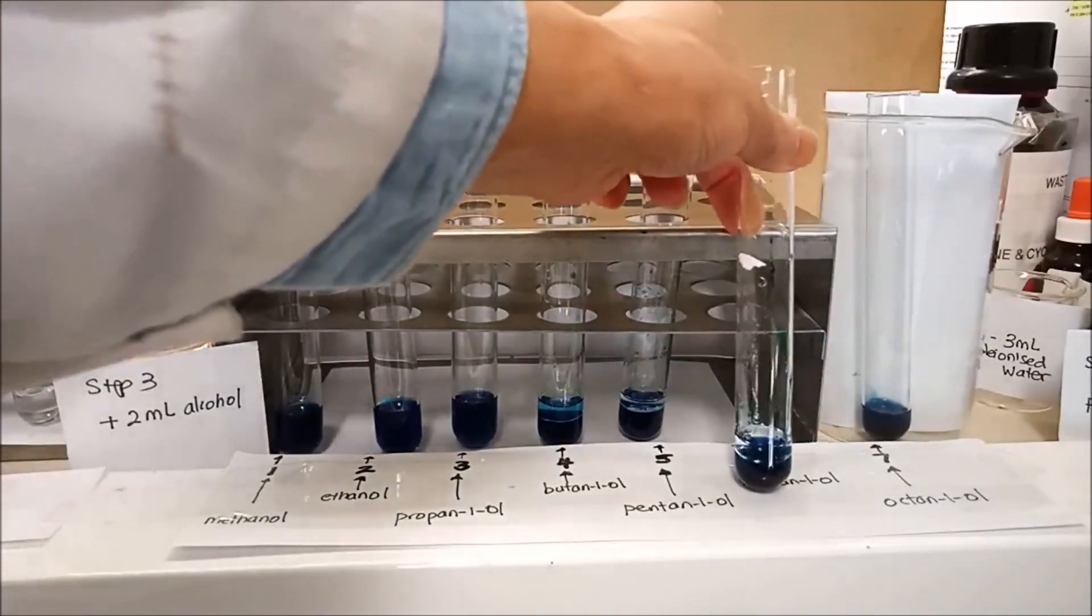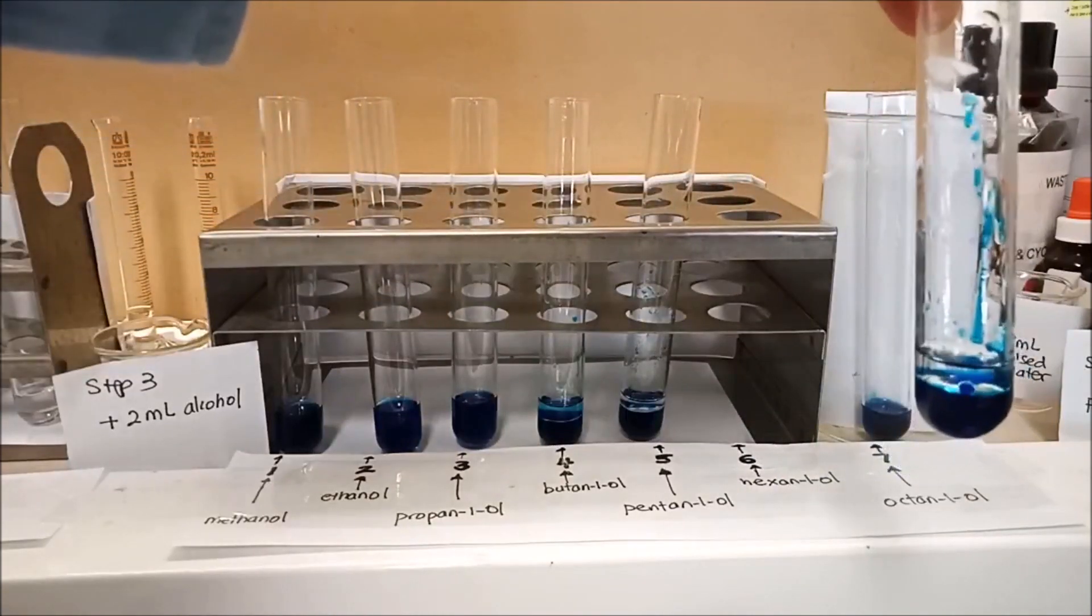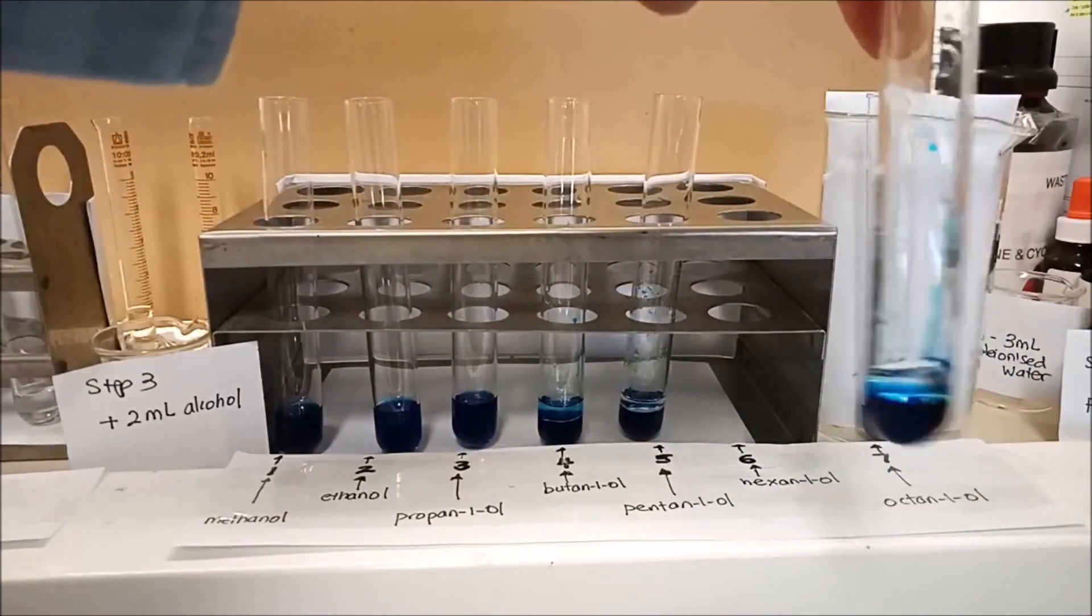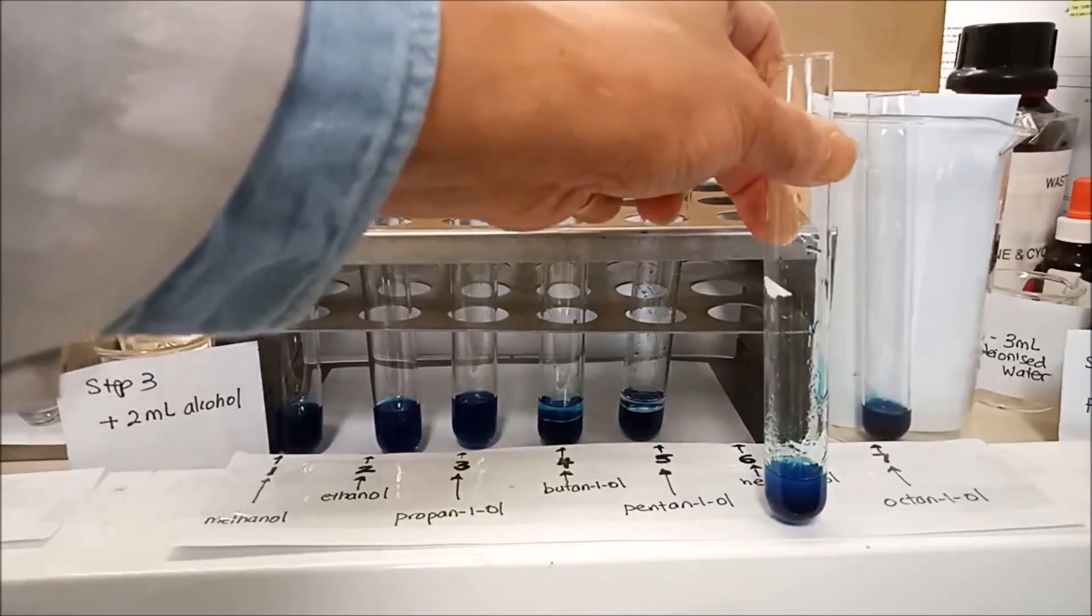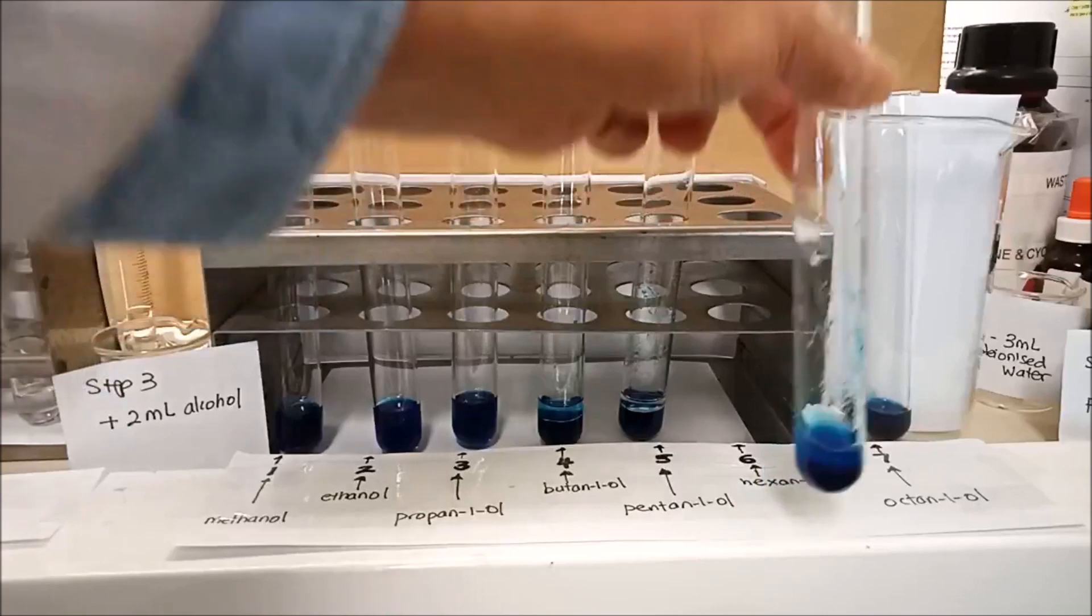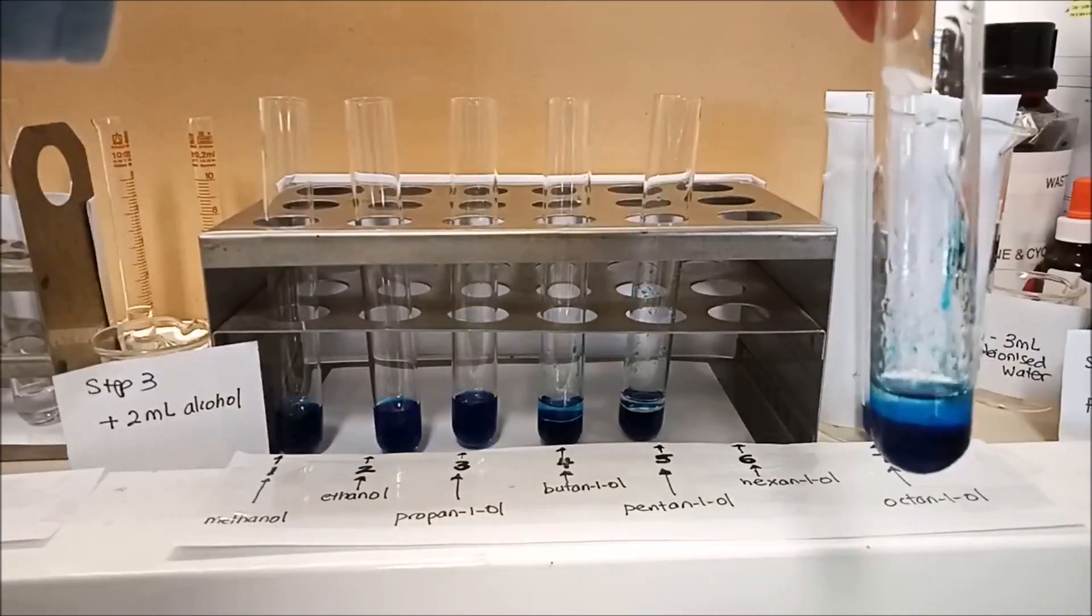Again, it's two layers which is floating on top. Two mils, three mils of water below. They are not mixable. Let's give it a shake and see what happens. Let it sit for a while. And sitting for a while, it turns light blue. You can still see the layer very clearly. Light blue on top.